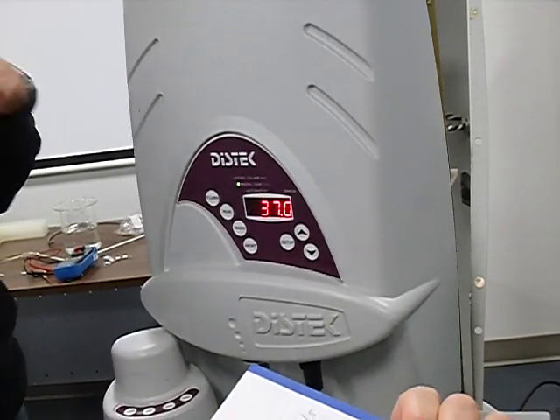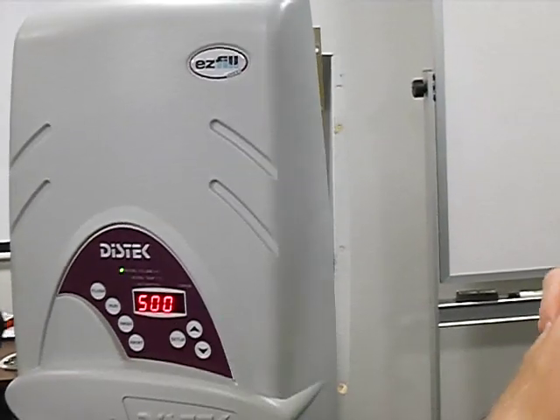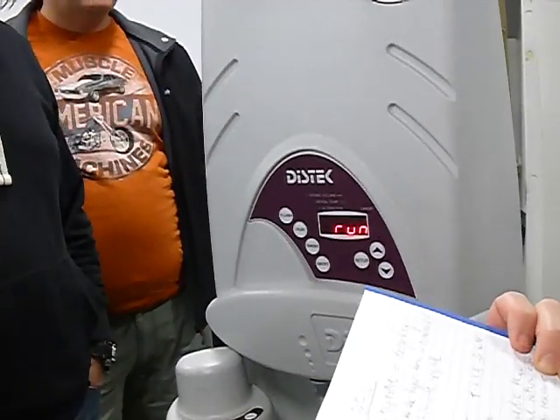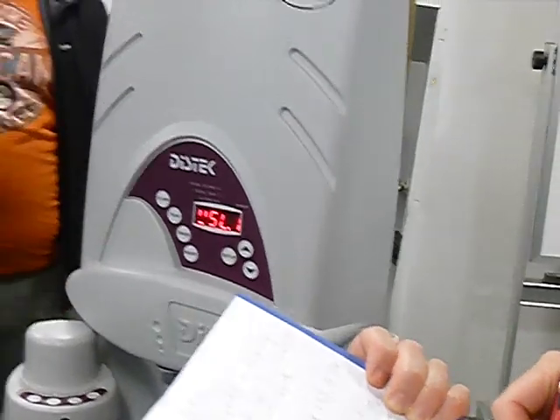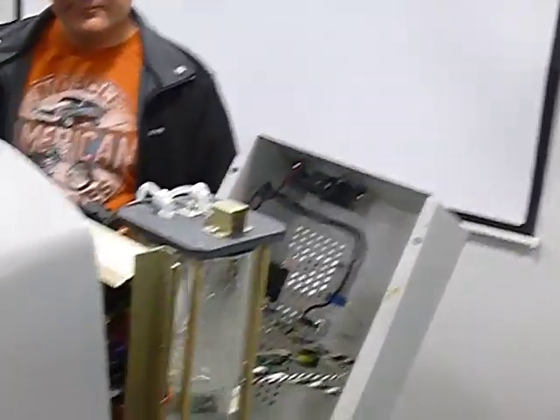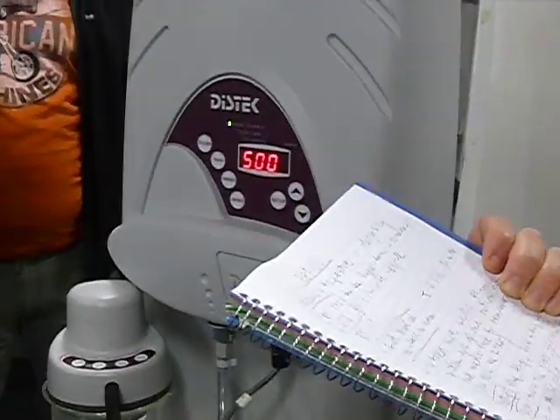It will start working slowly. It's going to go much slower. And that's for the SLS media, which is soapy. It causes a lot of bubbles, a lot of foam. It needs some time to get rid of the gas. So the offset time is bigger now. The motor speed is slower when it's drawing in or going out. I'd have to measure the time to see if it's half or down by a third, but you know it'll be a lot slower.